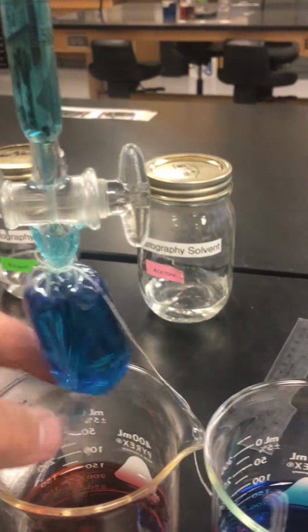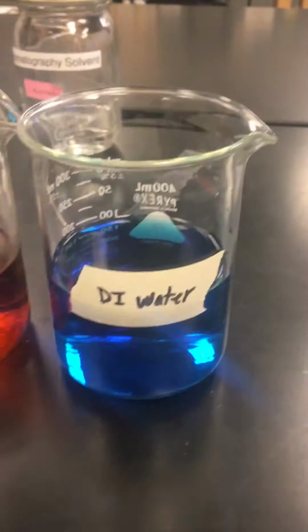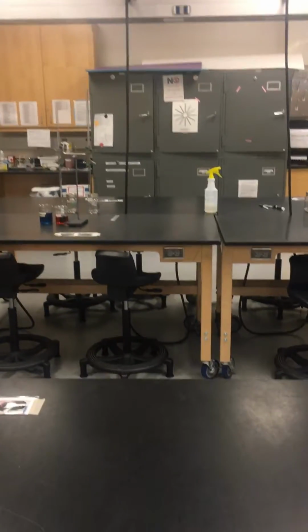After you tie the bag, both securely to the top and to the bottom, you are going to put deionized water, that somebody put blue food coloring in. You're going to carefully pour that into the burette.